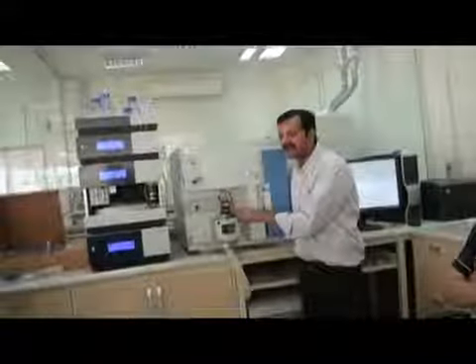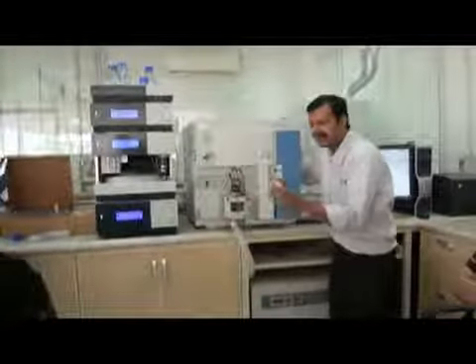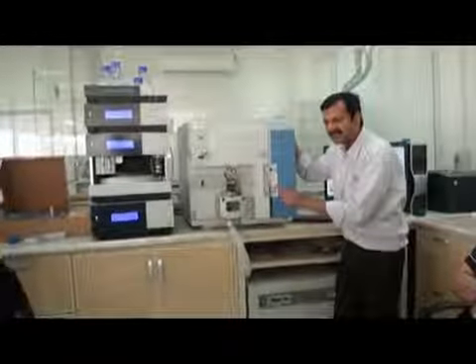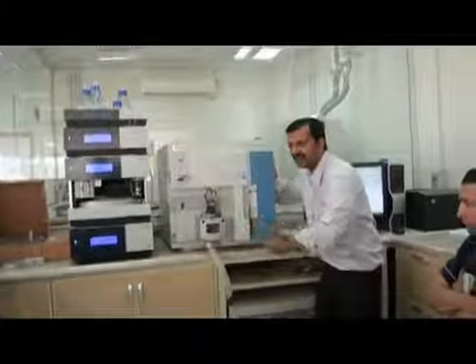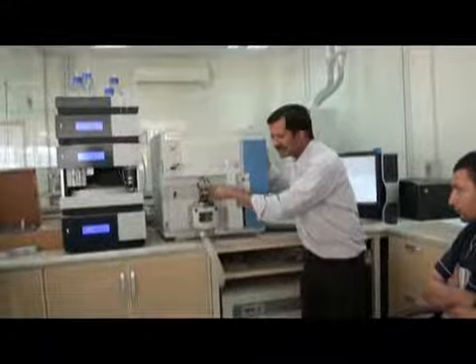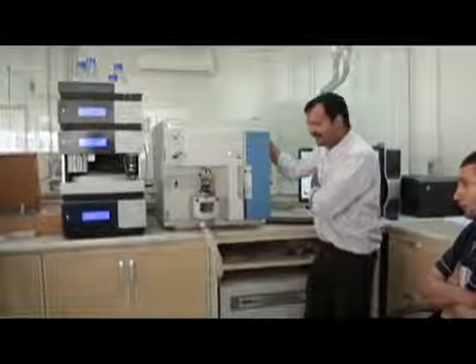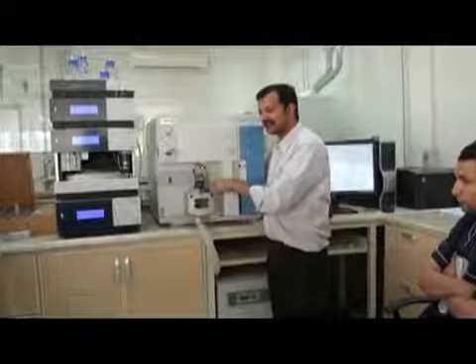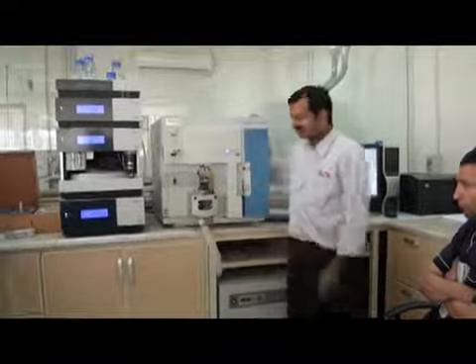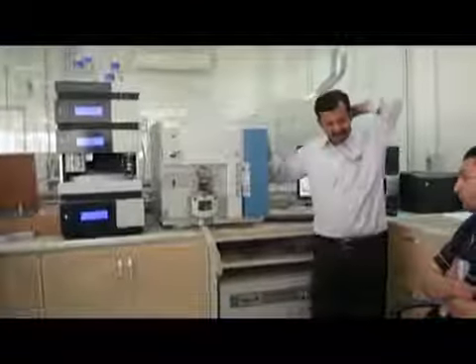Yes, this is the electrical connection for the heater. This comes here for heating. I told you this is a heated electrospray ionization. So there is a heater inside. We need an electrical connection to make heating. If you remove it, you cannot make heated. Yes, two electric. This is for the heater and this is for the high voltage. Two electrical connections here.